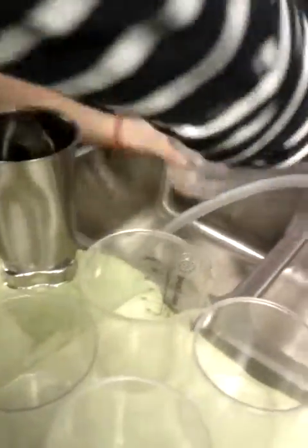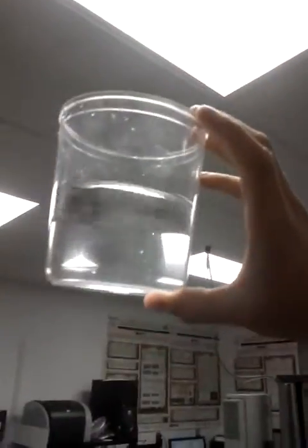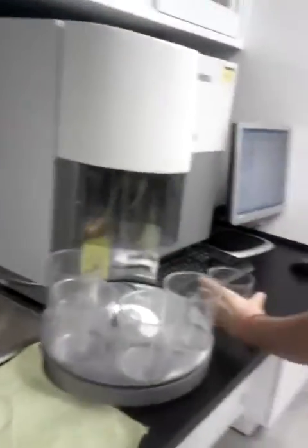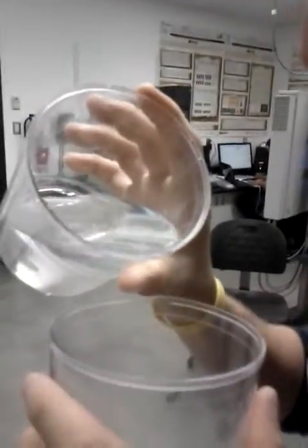For example, if you look against the light, you see the fibers. So if I put this solution completely, the equipment is going to stop because it's too concentrated. What I do, I always look just to avoid the big pieces.